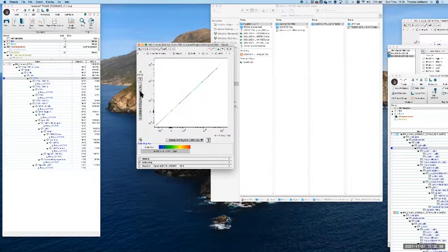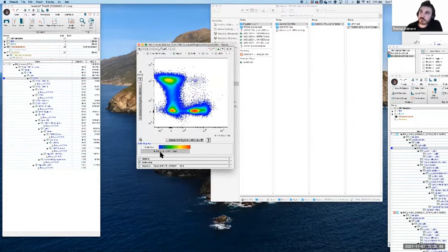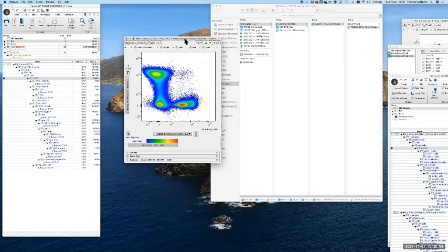Tom? Yeah. Can I just share a little trick that I use? Please, absolutely. If you have your N by N open, it's sometimes really easy just to scan through that N by N. So in the case we had FITC and PerCP, we had those super negatives, and you can just go down the column and then along the row on that PerCP channel, and if you're doing 15 to 25 color, you'll see which your culprits are. Especially for people who probably don't know their dye combinations as well as yourself, it's a really simple way of identifying the other culprit fluorophore that is leading to that super negative. So I thought I might just share that.